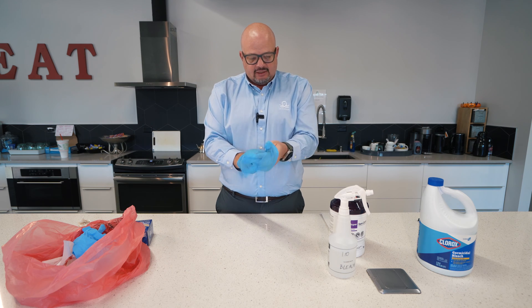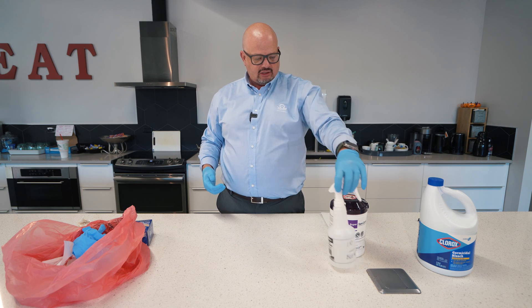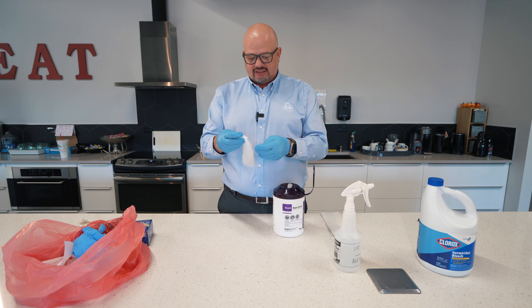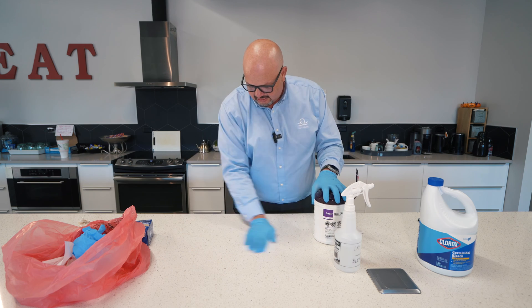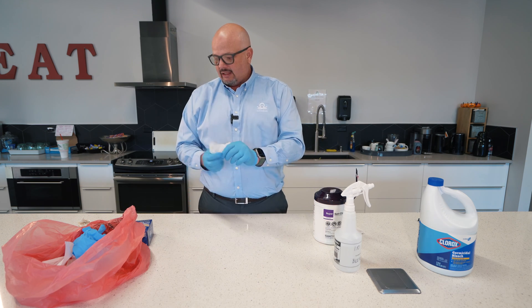The wipe needs to keep the surface wet for the contact time to work — this particular product has a two-minute claim. I'm not wringing it out; I'm just wiping the whole affected area and letting it dry. Now as you can see, I'm not quite done.